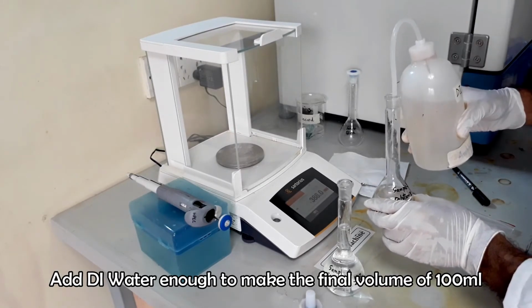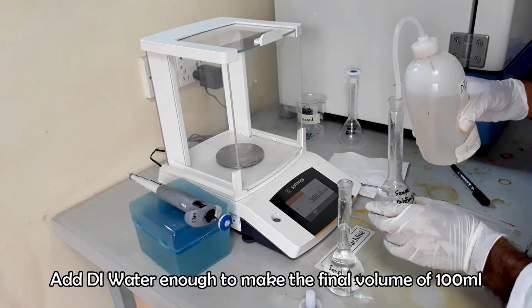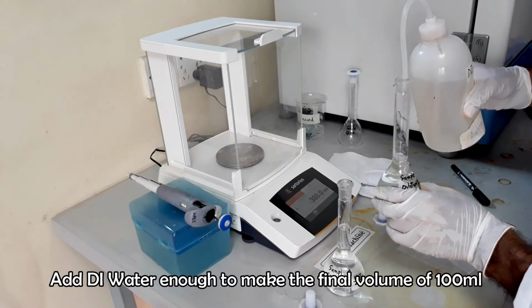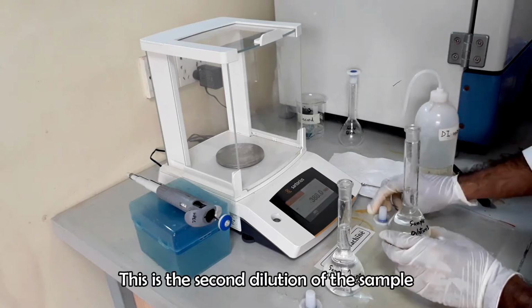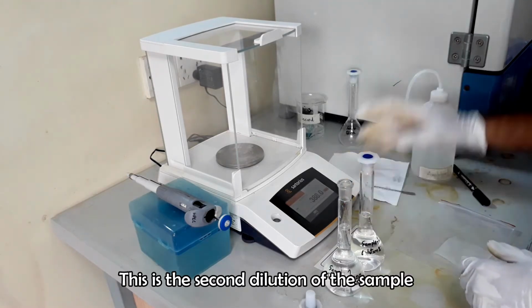Fill the second flask with deionized water up to the mark. Second dilution is now ready.